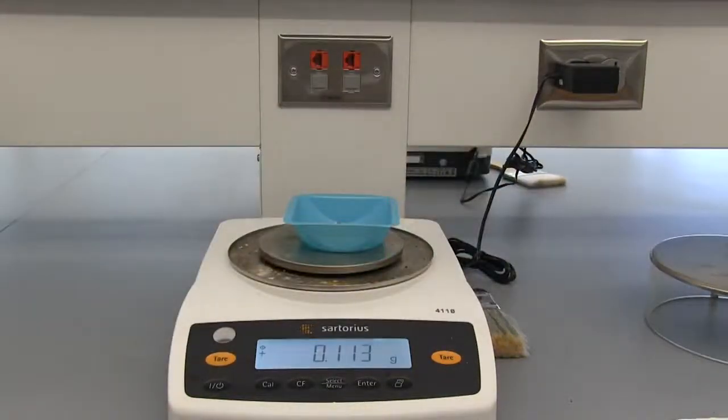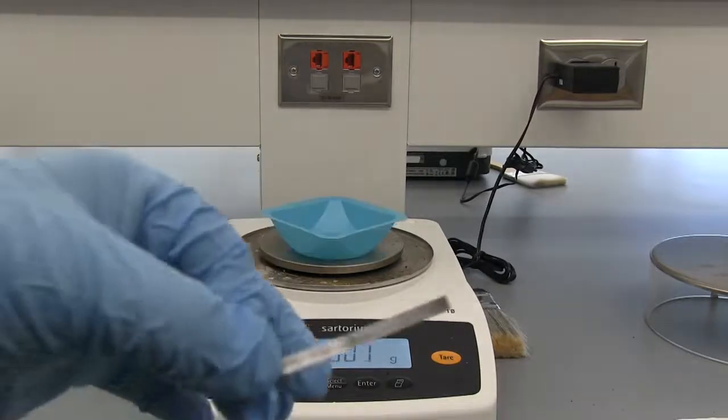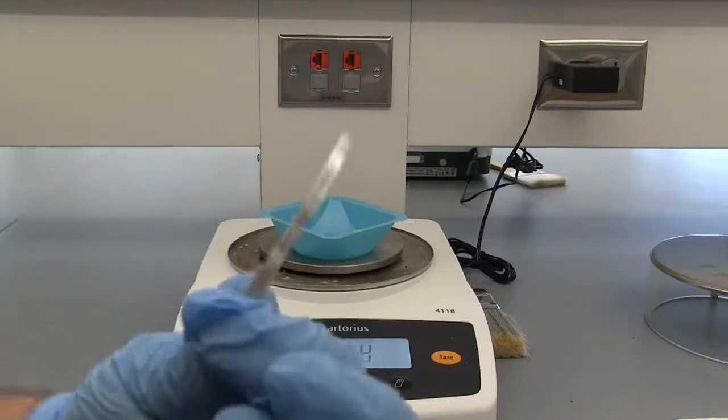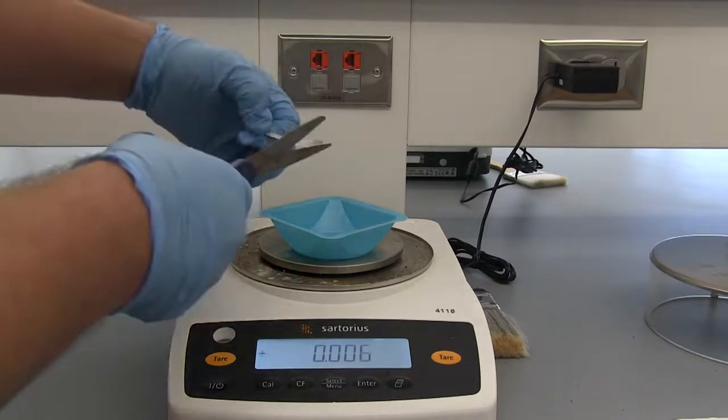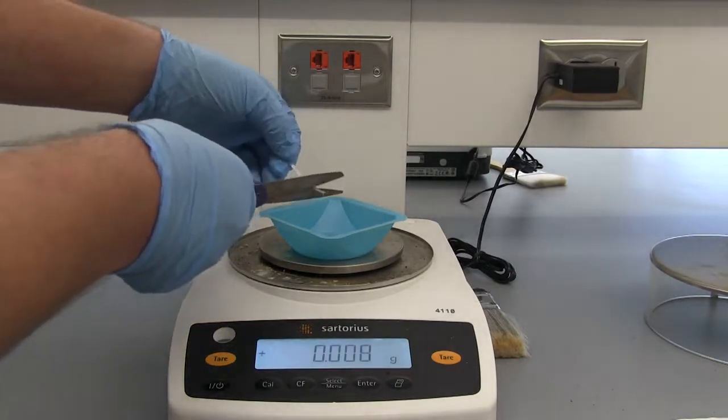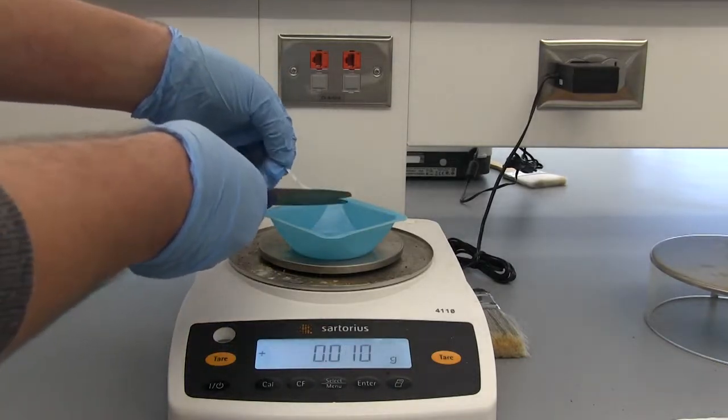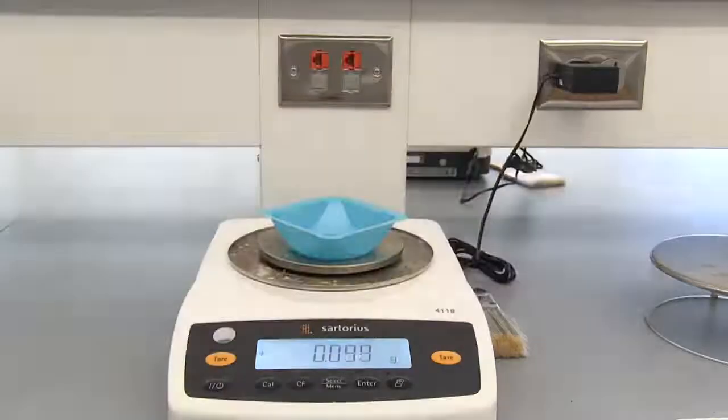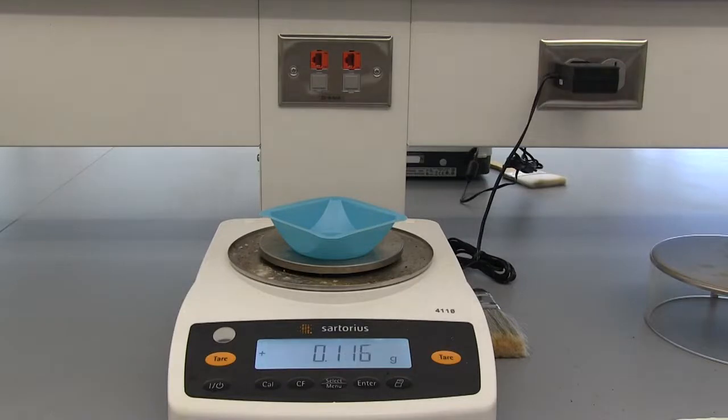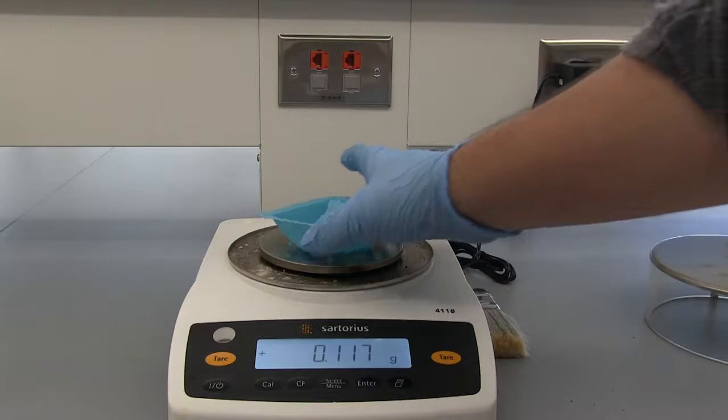That's a pretty good size. We'll let it settle for a second. We'll also get a new measurement once we sand it down and cut it into its strips. All right, so I've cleaned off any discoloration that was on there. And now we're going to cut it into a fourth of an inch strips or so. The smaller the strips, and the more clean it is, the better results you'll get. All right, we'll go with 116 milligrams. And we'll go ahead and add that to our round-bottom flask.